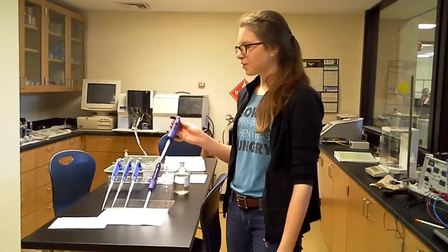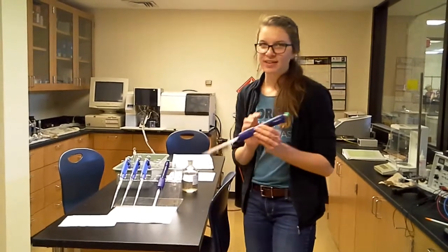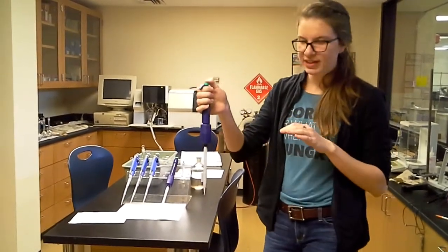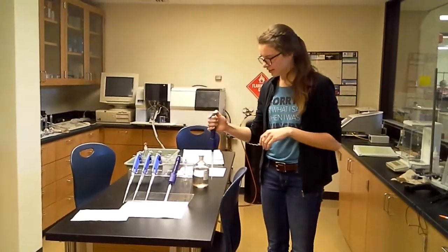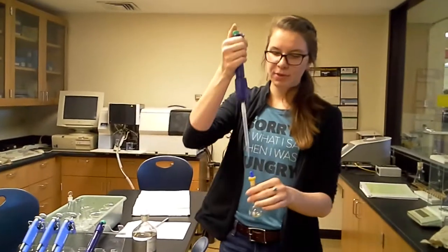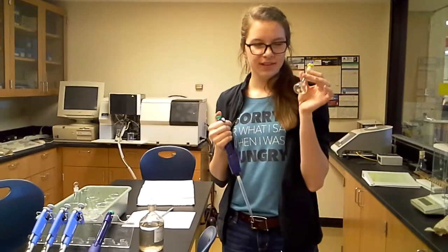So in lab 4, we will be using these micropipettes that will help in determining our precise concentration for each solution we'll be making. Now, how you use the pipettes is you push it kind of halfway down, then you put it in your solution that you're using, and then lift up, and then it's sucked up. Then you put it in your volumetric flask by pushing it all the way down this time. Make sure it's all the way down so that all your fluid is into the container you want.